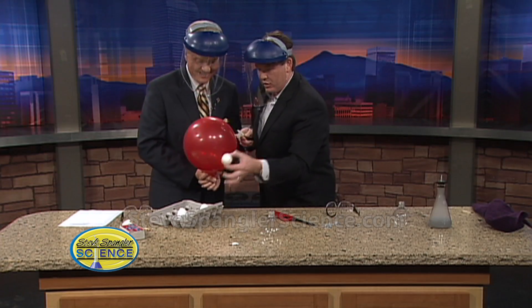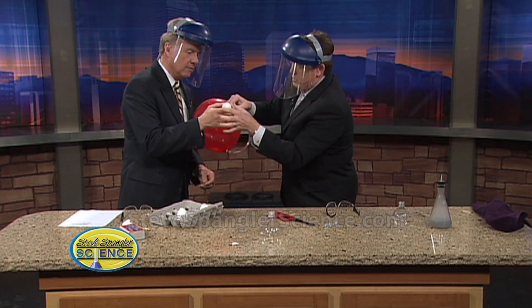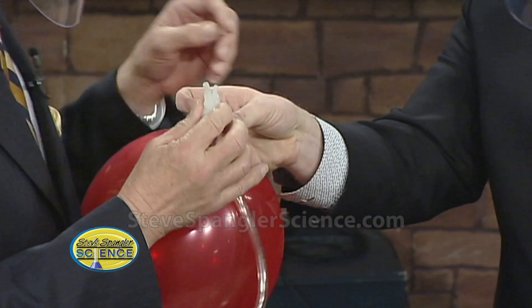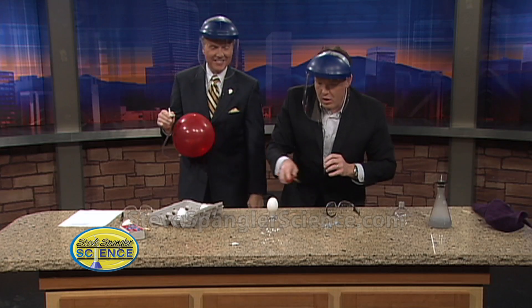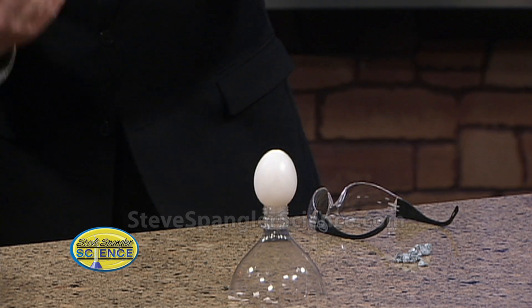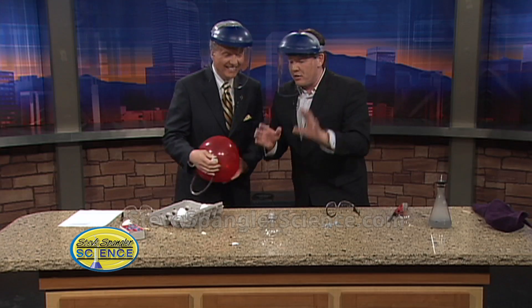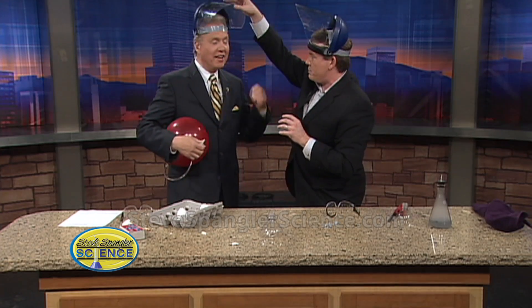So this is hydrogen gas in here. Try this — just hold on to this egg. So we're going to fill it with this guy. You don't put your finger over the top. Now close that off for me. So here we go. Let's see what this one looks like. Oxygen coming in. When we get to a two-to-one ratio — that's a good one, isn't it? Now this is the reaction that's taking place in a car. So this takes place in a hydrogen kind of car.